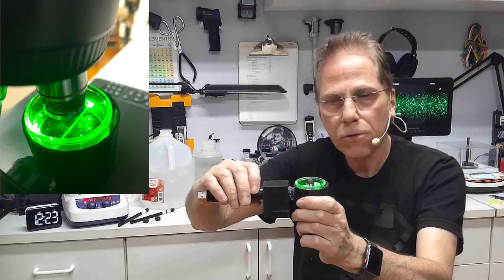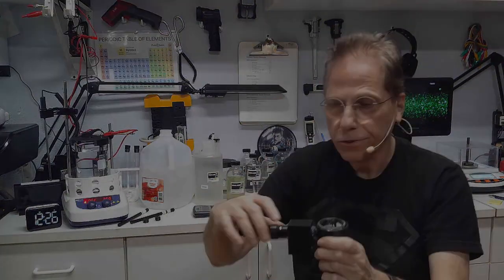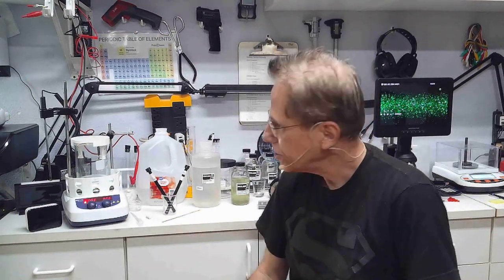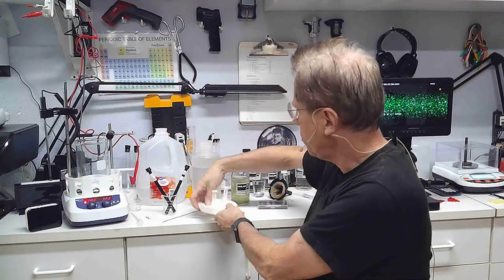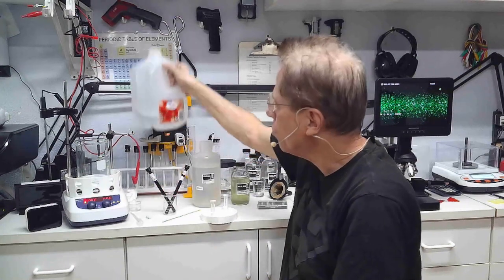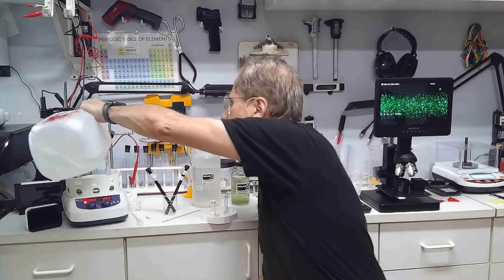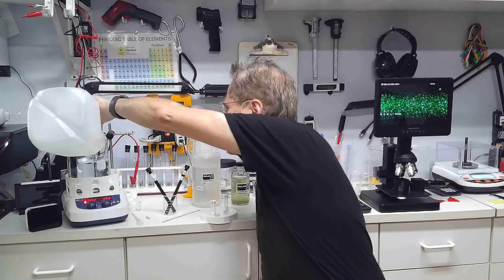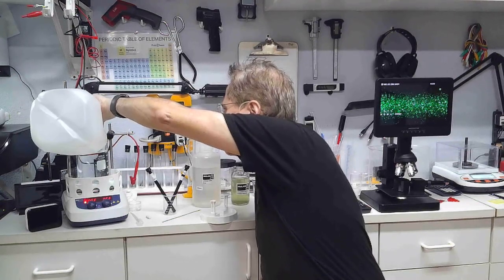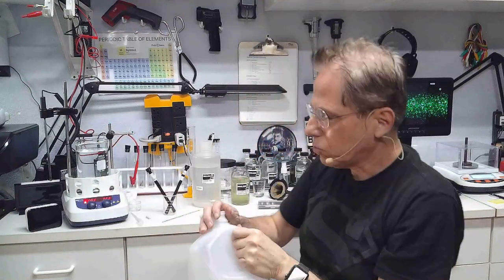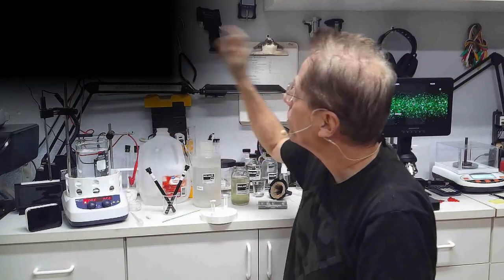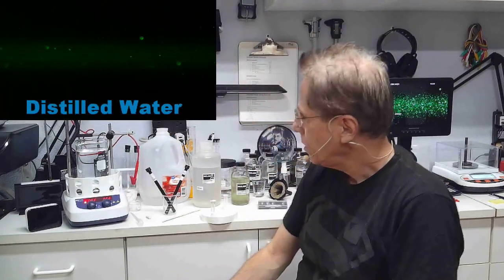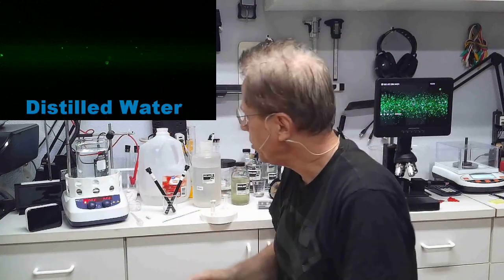Let's talk about the electrolysis process, being it is the integral part of this whole thing. First, we're going to use distilled water and we're going to fill my 500 milliliter beaker to 500 milliliters. This is distilled water, and this is what distilled water looks like on the microscope before we start. You can see how clear it is compared to the other picture that I showed you.